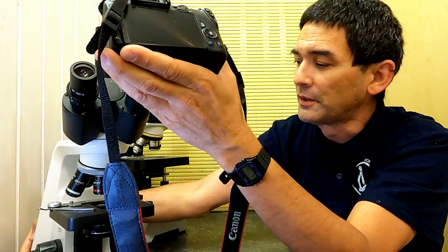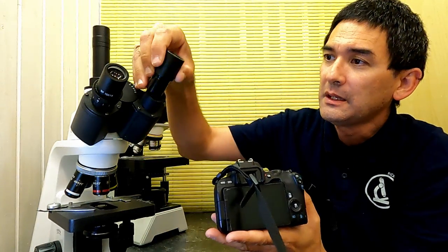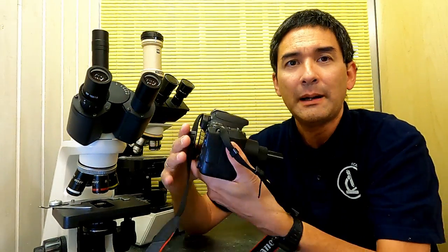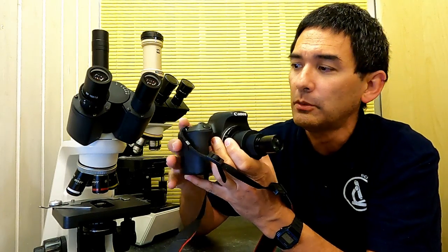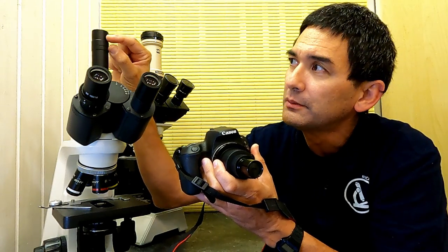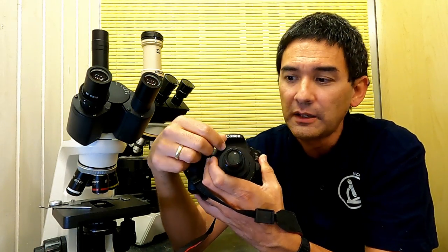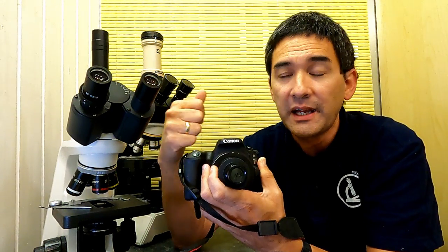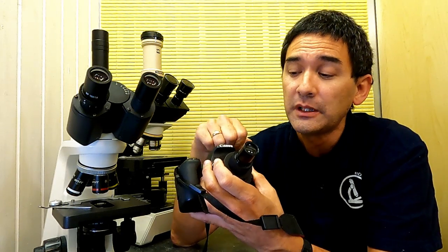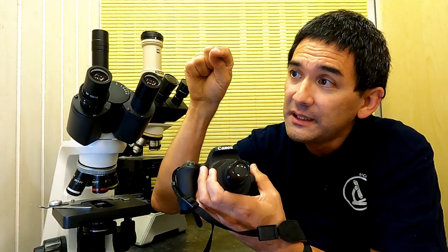The microscope is now also a little bit wobbly because it's standing on the cable, so that's kind of the idea. And the purpose of a camera adapter like this is to pick up the image of the objective, which is created approximately 1 centimeter down into the photo tube, and this is where the objective projects an image. It picks it up there and then adjusts the size of the image so that it fills the complete sensor. That's kind of the idea. And the second important function is that essentially it should be parfocal. This basically means that when I see the image in focus through the eyepieces, it should also be in focus in the camera at the same time.